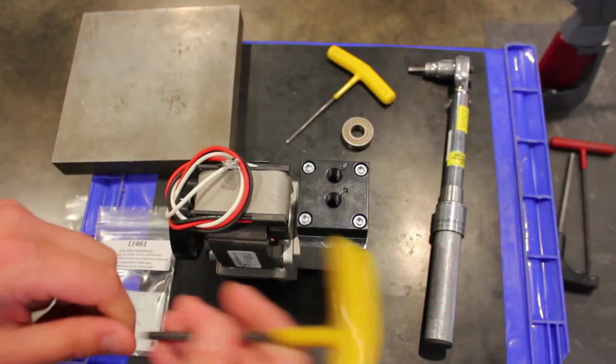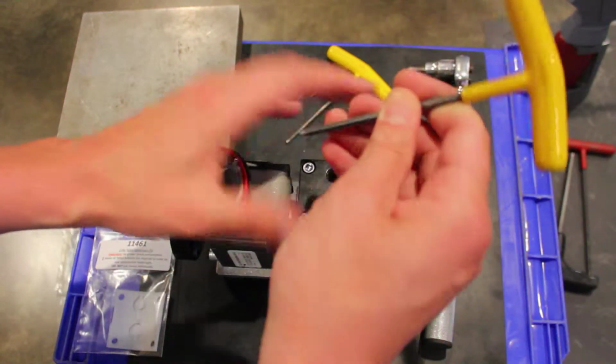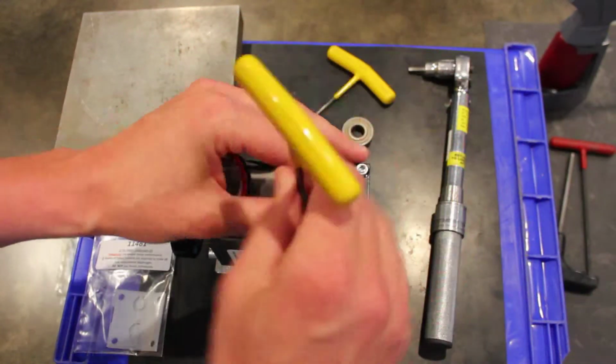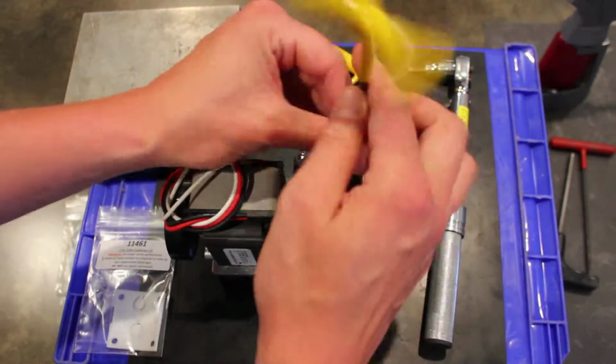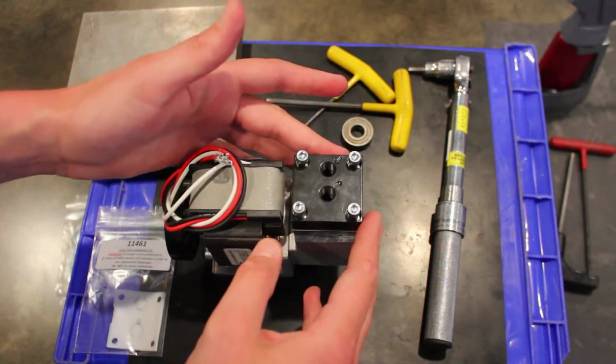So the first thing I'm going to do is remove these 4 head bolts on top of the head. And that's going to be done with the 5/32 Allen key. I like to leave the bolts down in the head assembly just because there's lock washers underneath the bolts and those can get lost pretty easily. Okay, so now all 4 of our head bolts are loose.